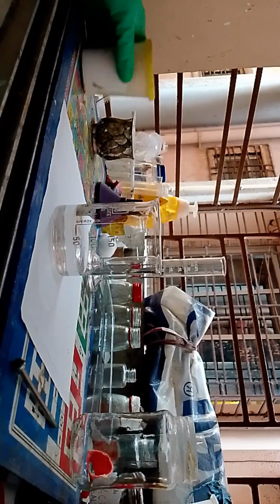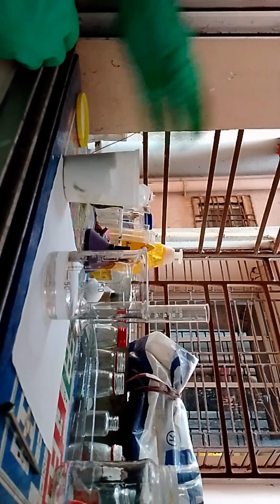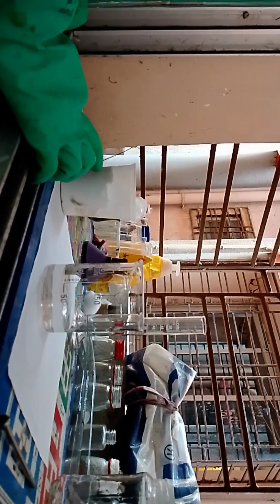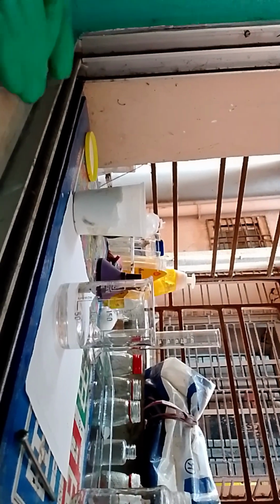Okay, so now this is our calcium chlorohypochlorite. I've got like 500 grams of it. Now we are going to drop the calcium chlorohypochlorite into the sodium carbonate solution. We know that calcium carbonate is very insoluble in water, so it will drop out as a precipitate, like in the video in which I made sodium hydroxide, where the precipitate formed and went to the bottom.